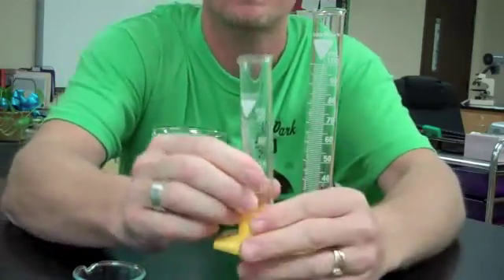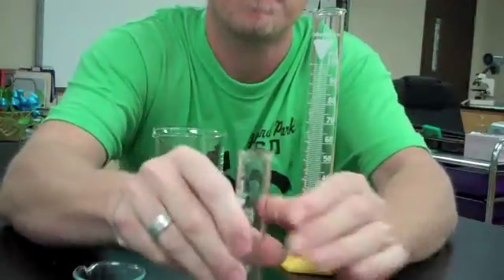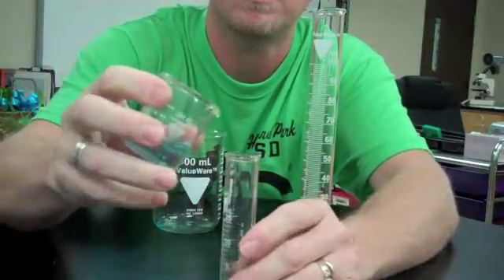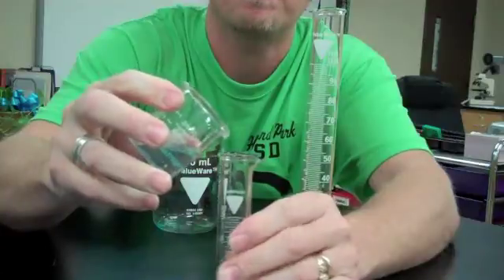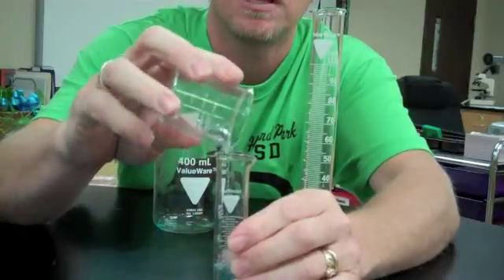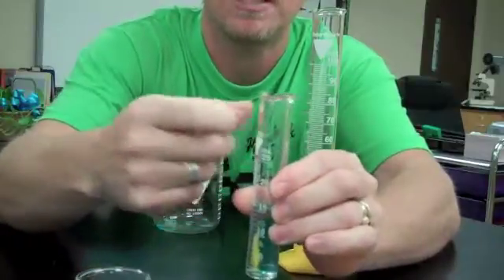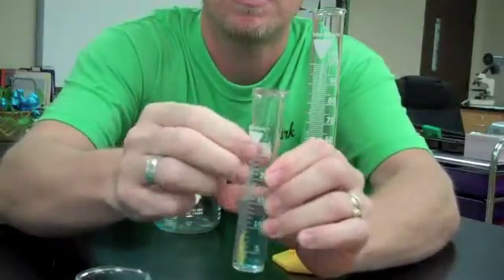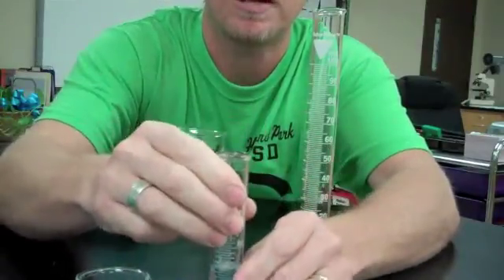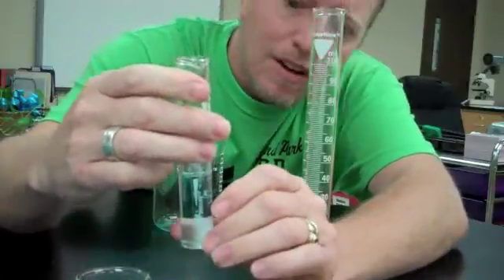I'm going to go ahead and pour what liquid is in this particular beaker into this graduated cylinder. I want to try to get it all in there. Of course, you sometimes get a little bit that's going to drip down the sides, so we want to get down what we can. Remember, we were saying it was about 15 milliliters.